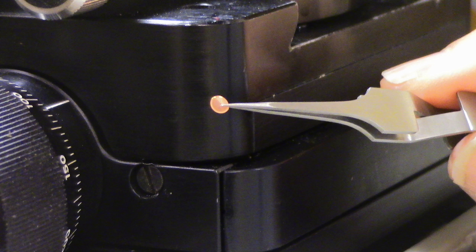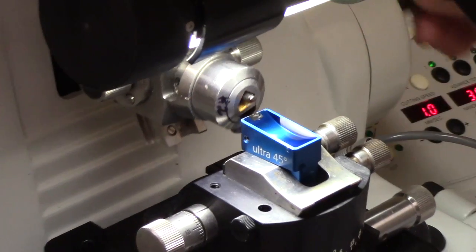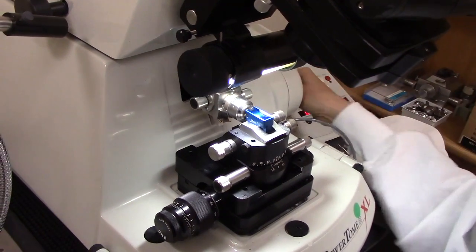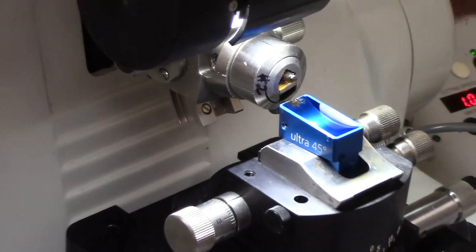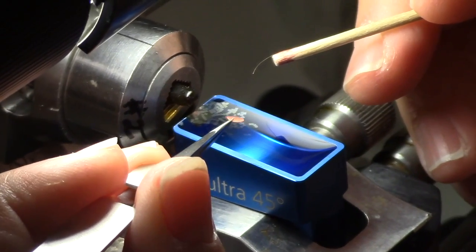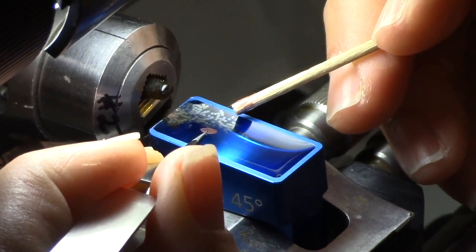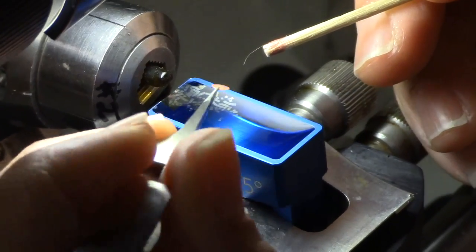This grid looks like your screen door — it has bars and it has holes in the center. Our sections are going to be on this grid and go into the electron microscope. Right now I'm going to show you how we cut your block, pick up the sections, and put them on this grid. I have my grid in my left hand and I'm going into the boat — you can see the sections floating — and I'm going to help the sections go onto that copper grid. Those sections contain the spores that we will then look at on the electron microscope.